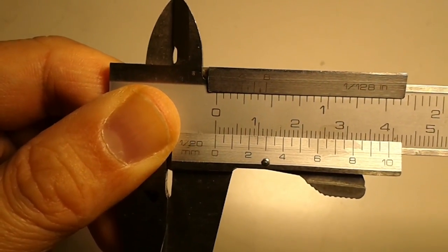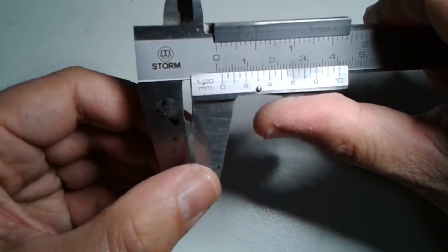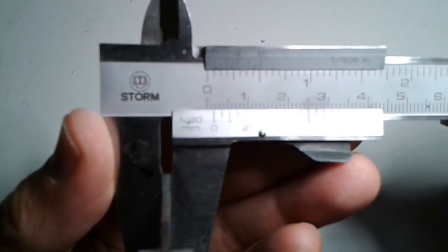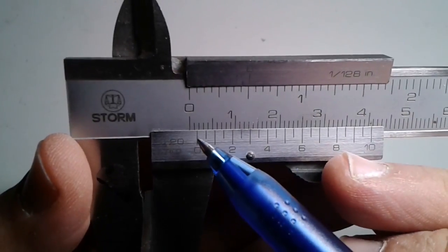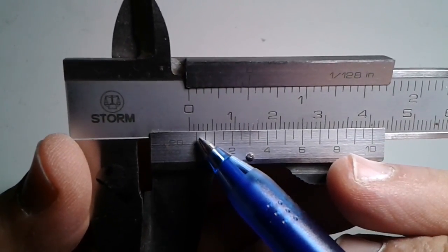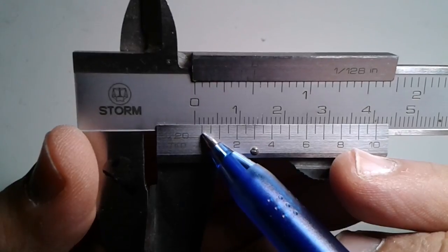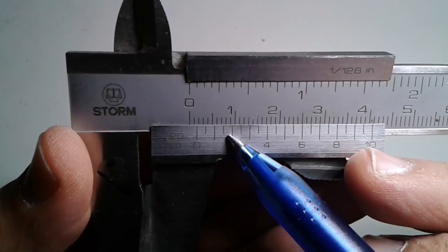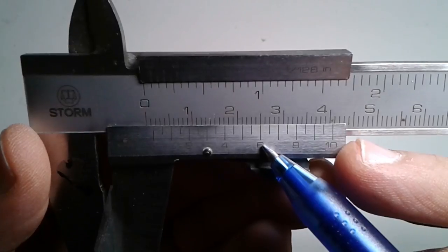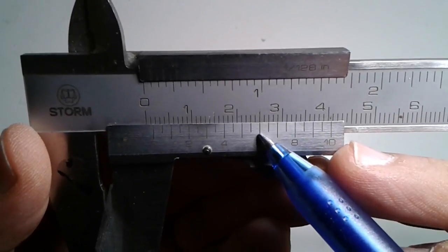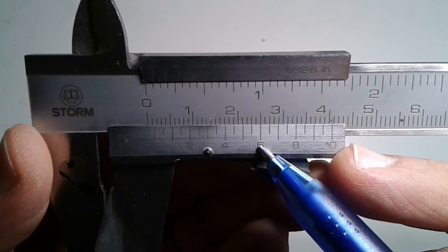In this case let's see what do we have here. It is one millimeter and one and a half, around one and a half. Let's see which lines match up. 1.5, 1.6, yeah I think 1.60, that could be the thickness of 10 cover glasses. So you can see we're getting a little closer here.